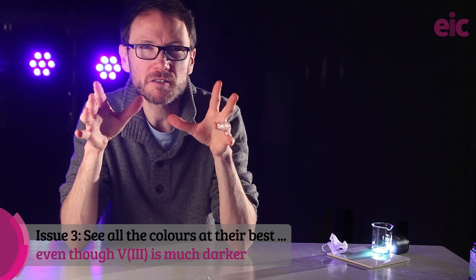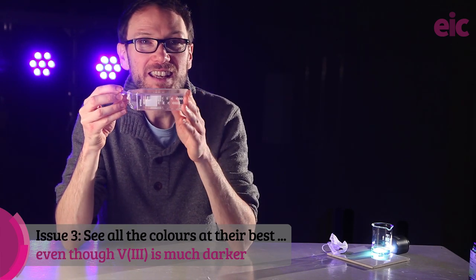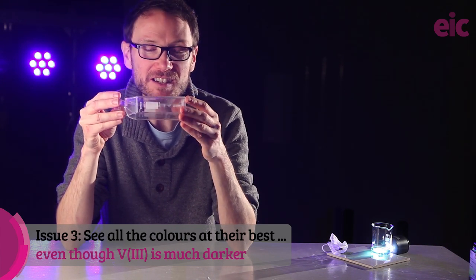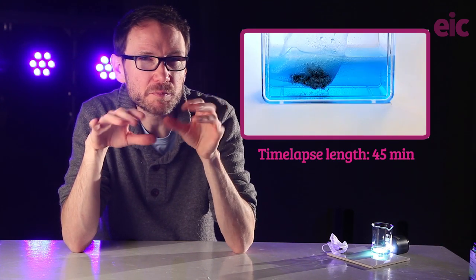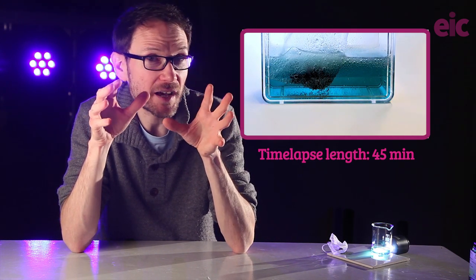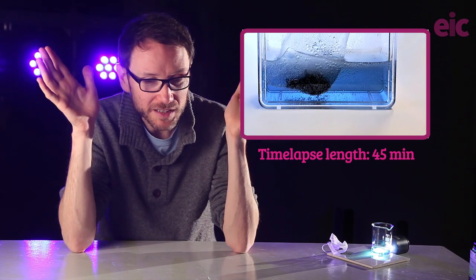So after rummaging around the whole biology department, I found one of these, and to my chemist friends who are like, what the hell is this? Apparently it's a cell culture flask, and it's actually really nice for running this reaction in. Let's give it a try. This is in a 0.05 mol per decimeter cubed solution now, following the CLEAPSS method, but at half the concentration of the vanadate. My granules in a tea bag are now producing some beautiful colors, and by viewing from different angles you can actually enjoy the various hues along the way. But speed is still a problem.